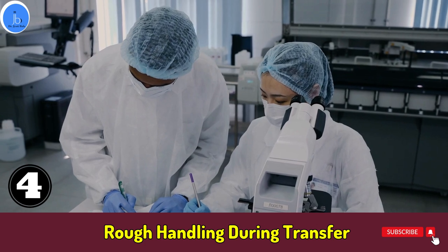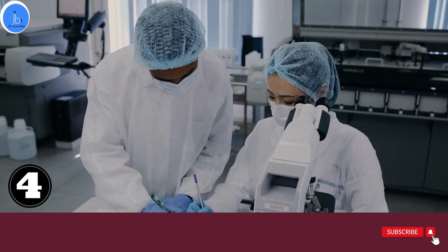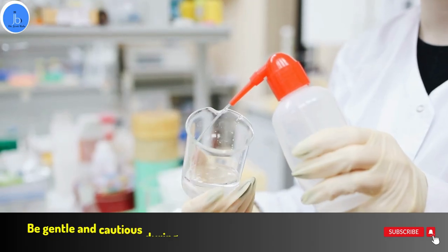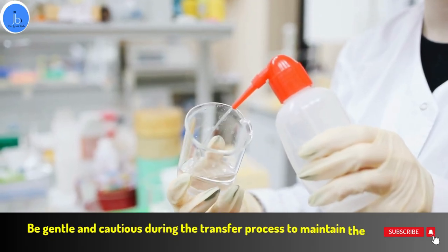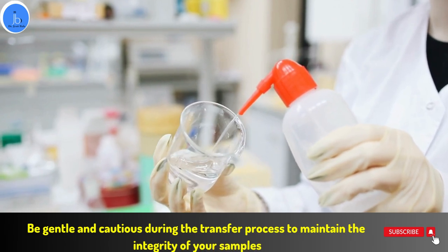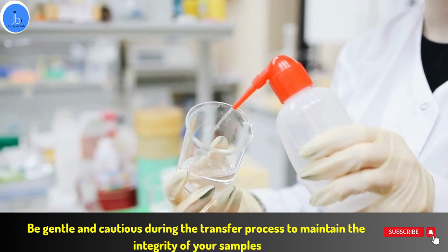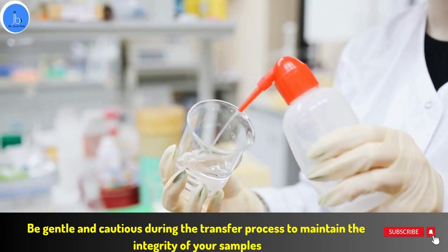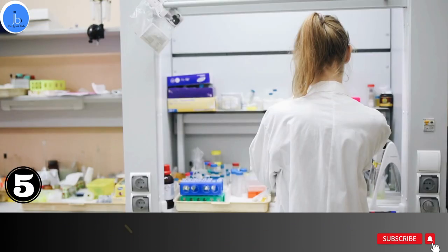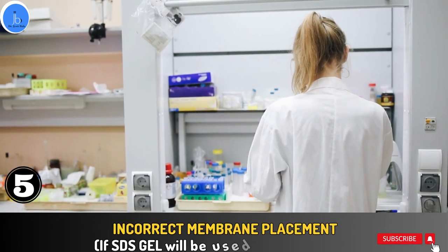Mistake number four is rough handling during the transfer. When transferring protein from the gel to the membrane, rough handling can cause smearing or loss of protein. Be gentle and cautious during the transfer process to maintain the integrity of your protein samples.